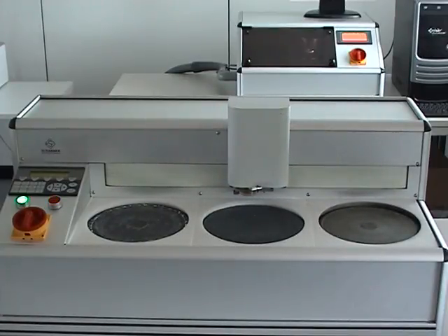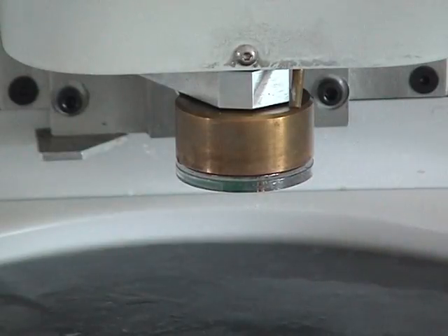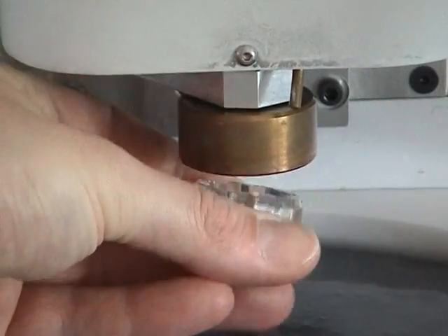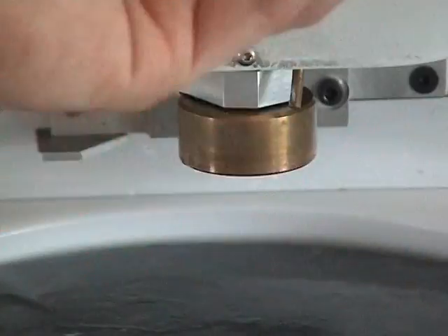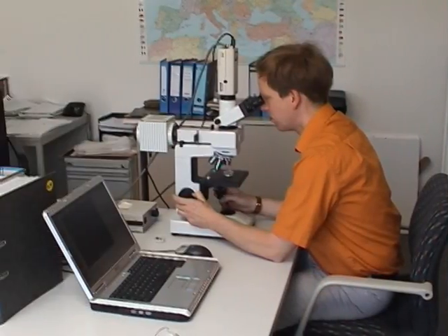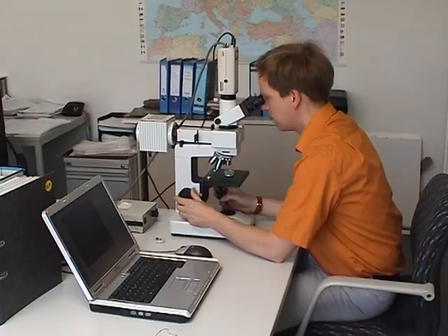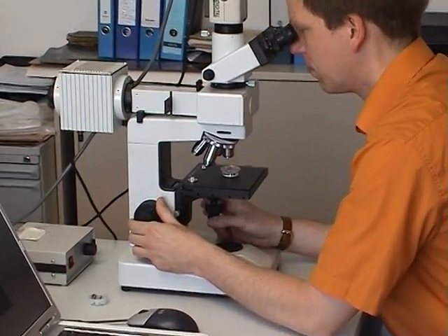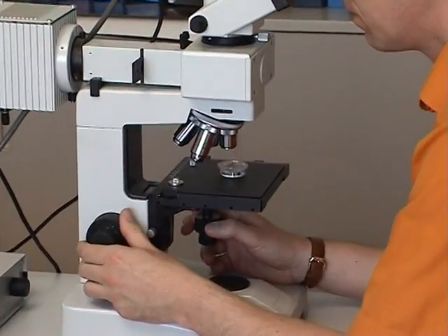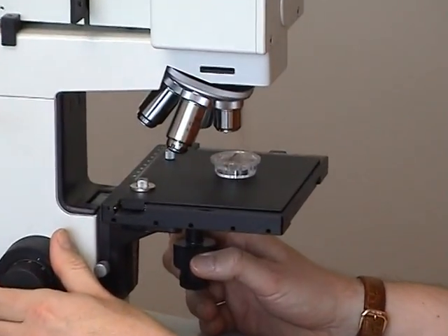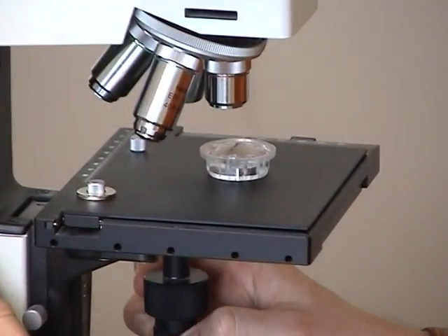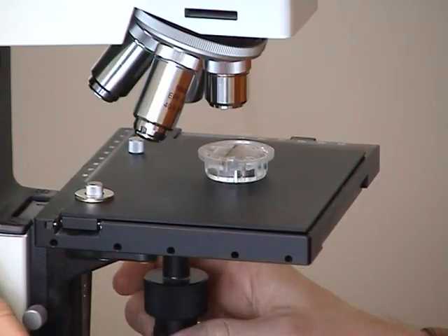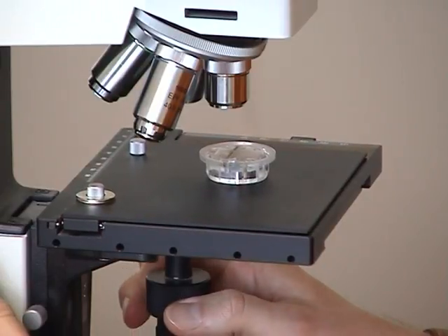The finished microsection, grinding and polishing is done, can now be used for further analysis. The detailed analysis is done under the microscope at different magnifications.